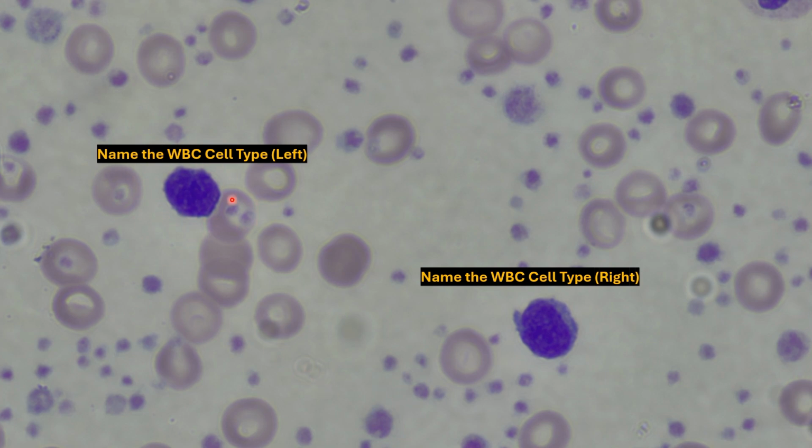So with this leukocyte over here, if you squint your eyes and look in the middle right here, perhaps you can see the overall outline of the nucleus. It doesn't quite look S-shaped or bilobed in this case, but we can see there are these areas of darker staining granules that stain dark purple or basic. Therefore, we have a basophil. Compare that to this leukocyte over here, which is pretty easy to confuse the two between. We can see the overall nucleus, but we can see the cytoplasm here to the side where we don't see those granules stain quite as apparent. Therefore, we have a lymphocyte.